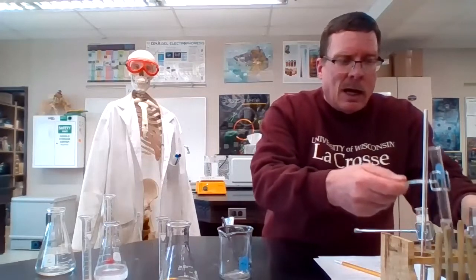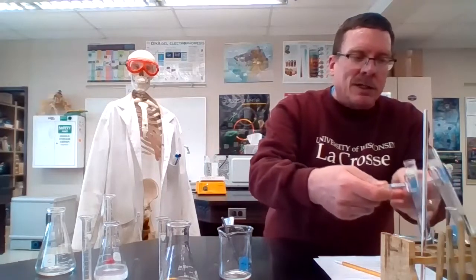Okay, we're back. All right, so here's what I've done, and I need to grab my stuff here. I held these, we're at the 5 degree. Here's B. I held these in the ice bath until they all reached 5 degrees. And now we're going to just do the same thing. We're going to mix A and C at the same time.